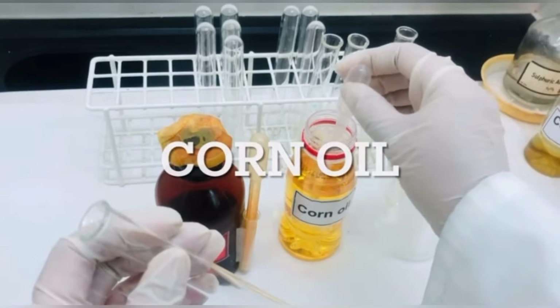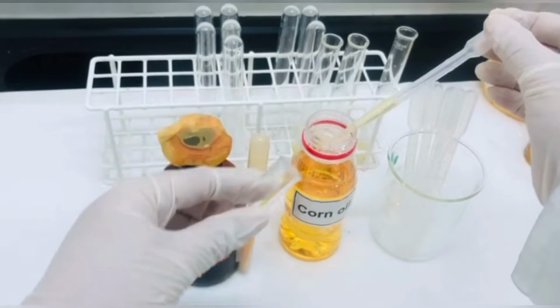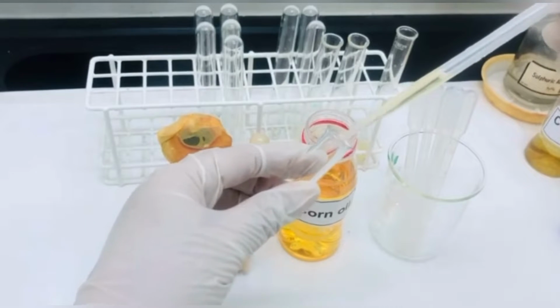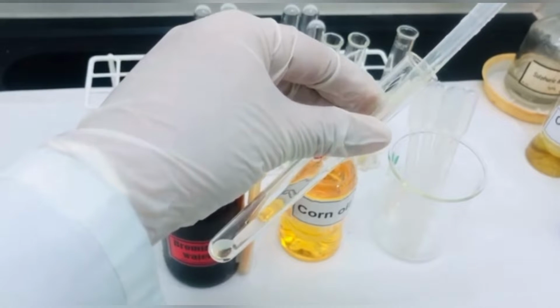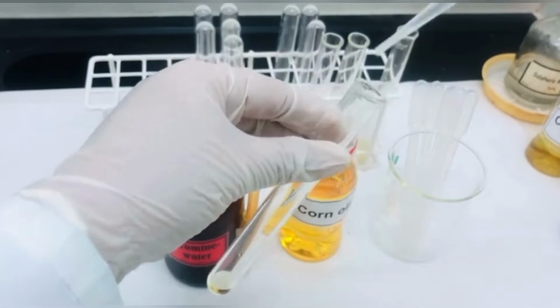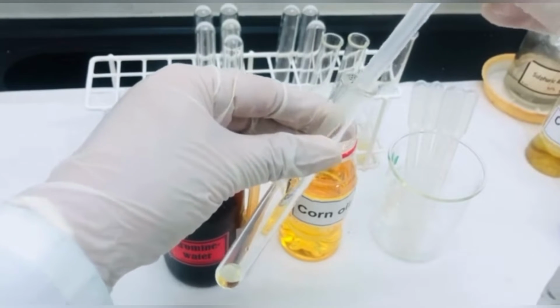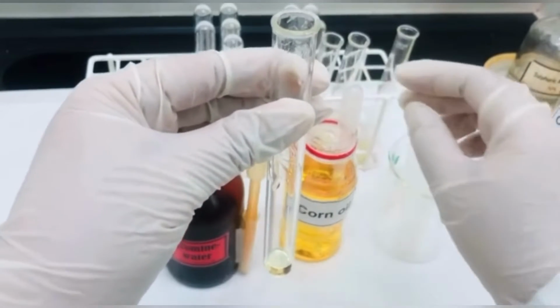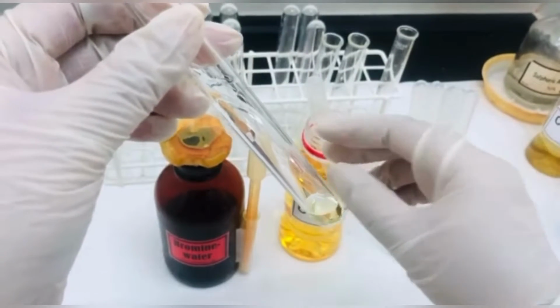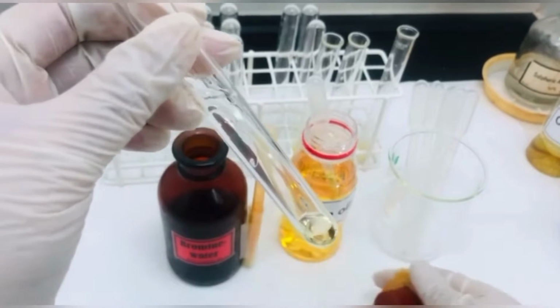The next sample that we are going to use is corn oil. So we will take around 1 ml of corn oil sample in the test tube, and we will add to it a few drops of bromine water.